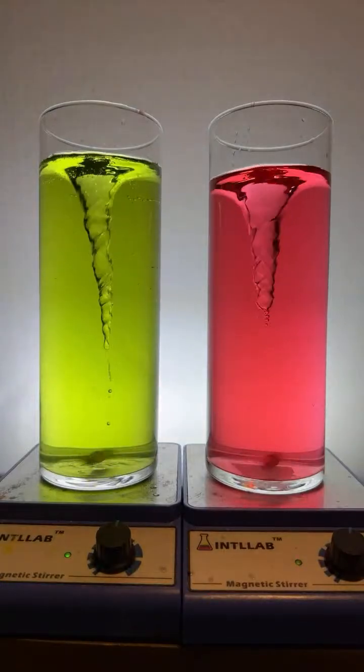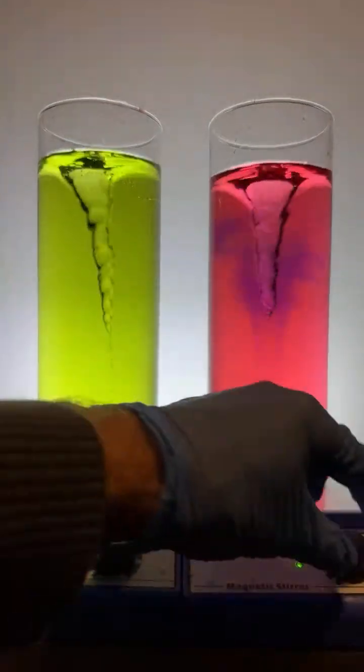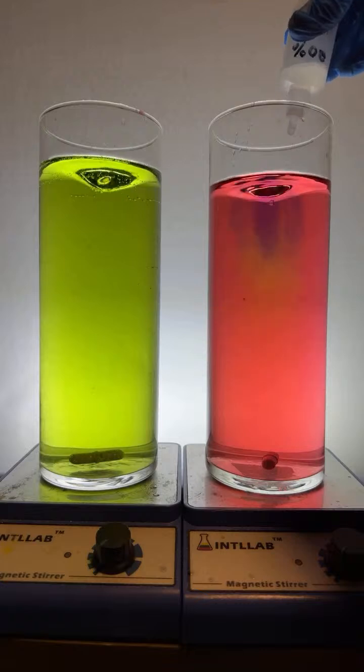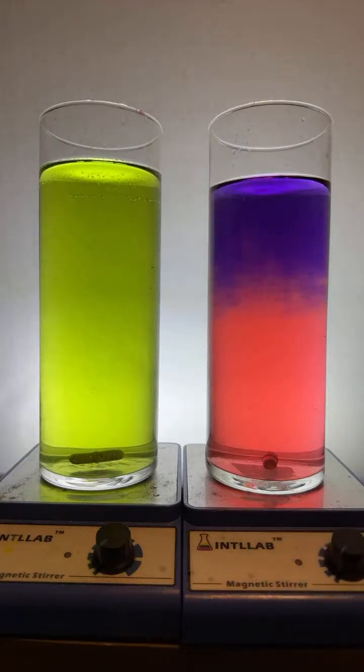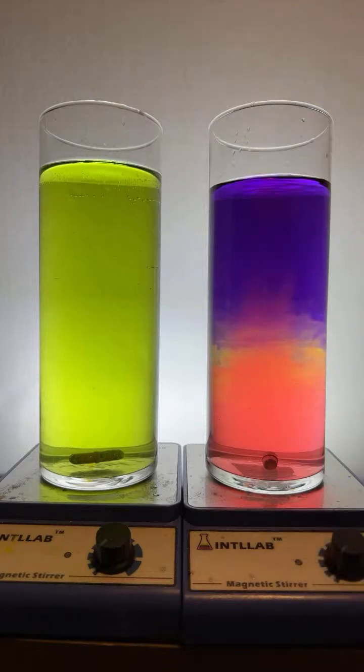When there's a lot of acid around, here, let's do this while I'm jabbering on, so at least you've got something to look at while I'm talking theory. I'm going to slow that down. I'm going to add a lot of base over here, and we're just going to see what happens to this side. Who knows what's going to happen? Maybe I'll chase it with a little acid. What's going to happen over there?